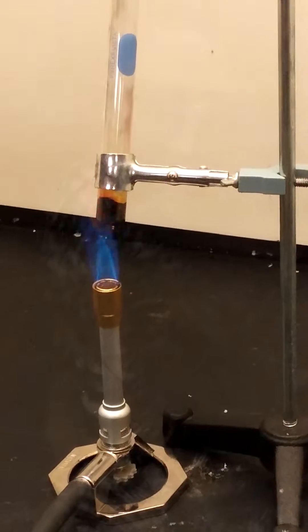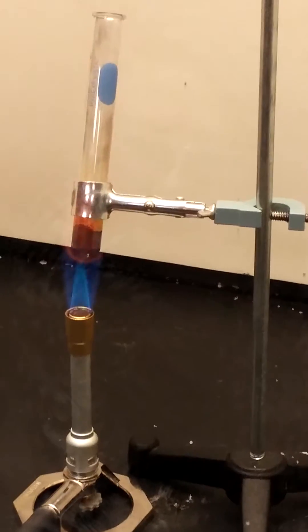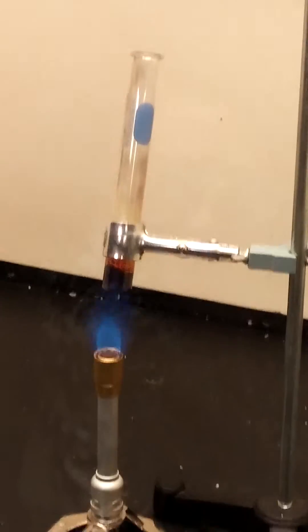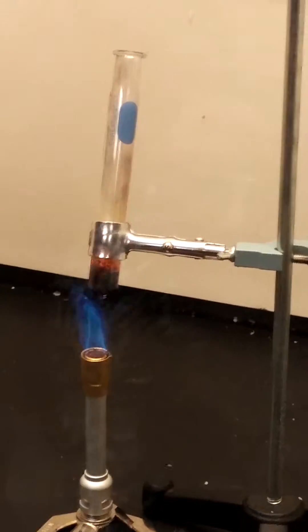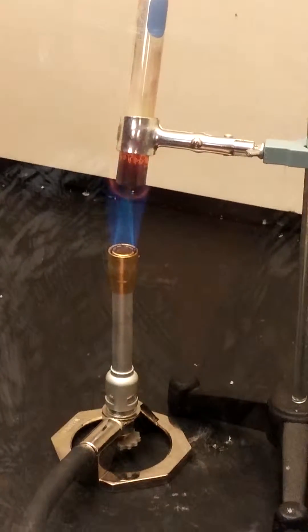It's like a stereotypical way. It's not really cool. I'll take a picture. It's growing — it's not bad. Well, that's why we're using a test tube. That's fire. No, don't. Don't do it. You'll die.